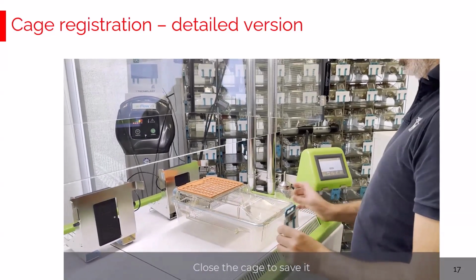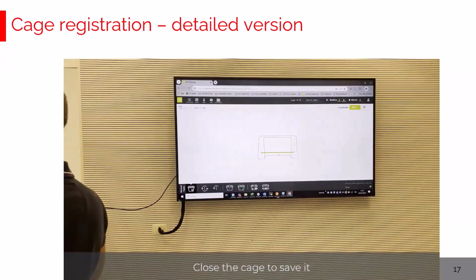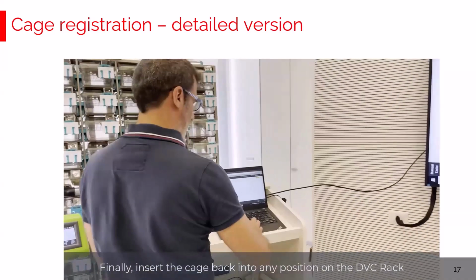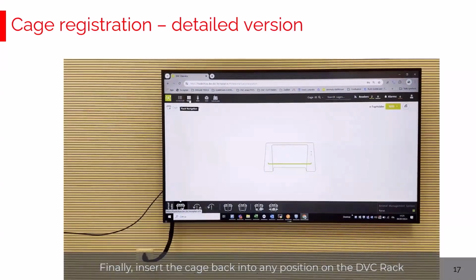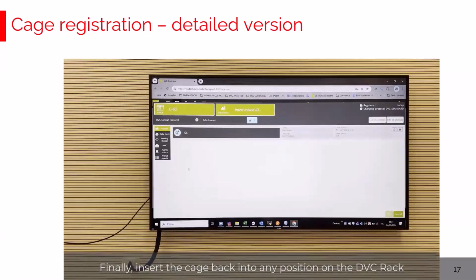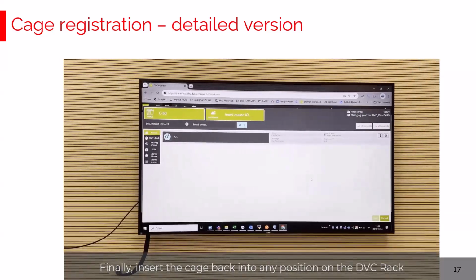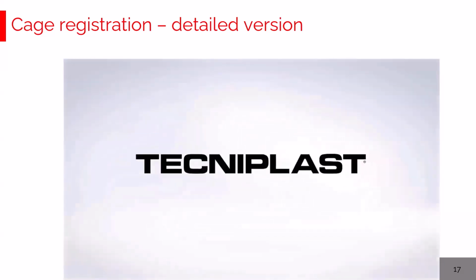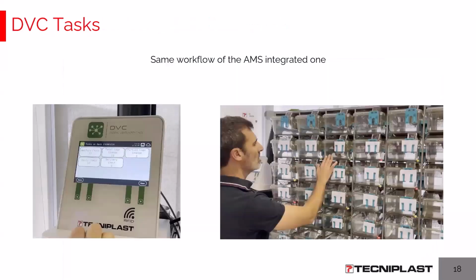By closing, the cage has been registered and created also in the DVC Operator interface, and now can be simply inserted into the DVC rack as a registered stock cage. Here it is. Perfect. From now, the system is collecting data and monitoring for any kind of alarm. So, as said, in this preferred workflow without AMS, in case you want to be completely and fully aligned to the cage content, you have to use the DVC Operator interface. We don't see any other option regarding this.